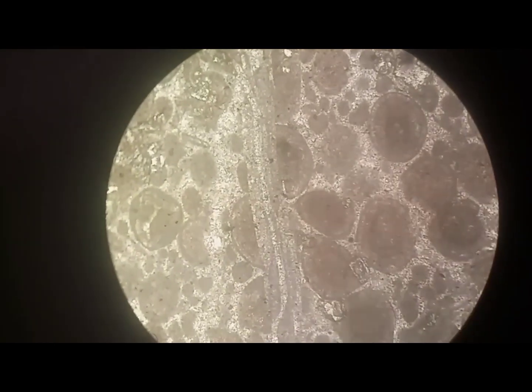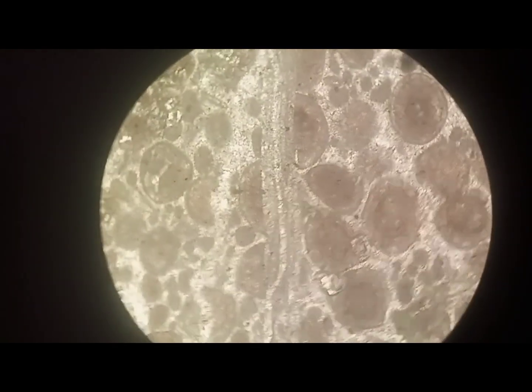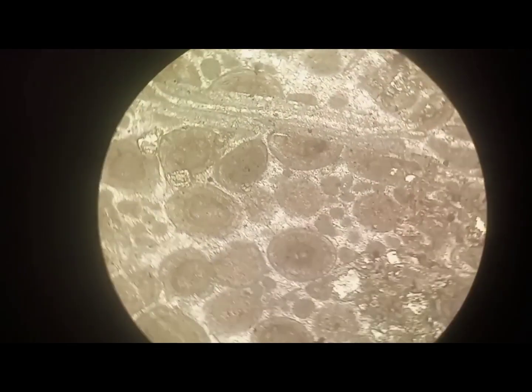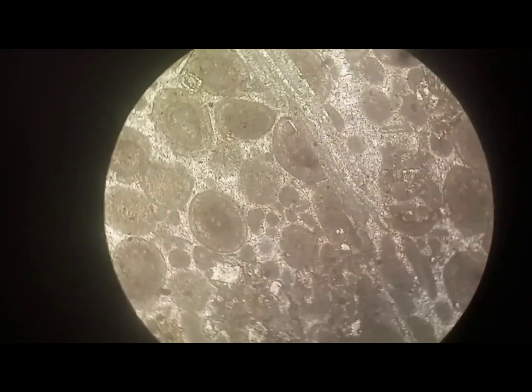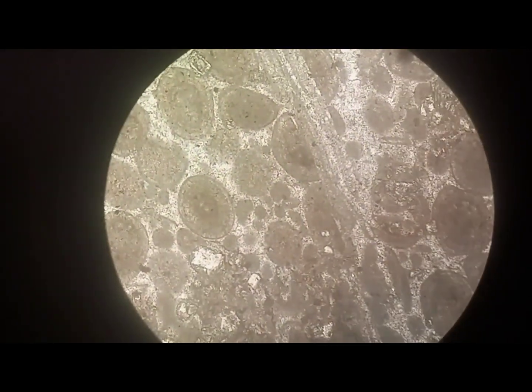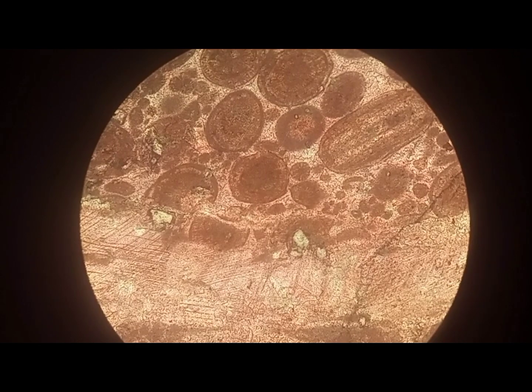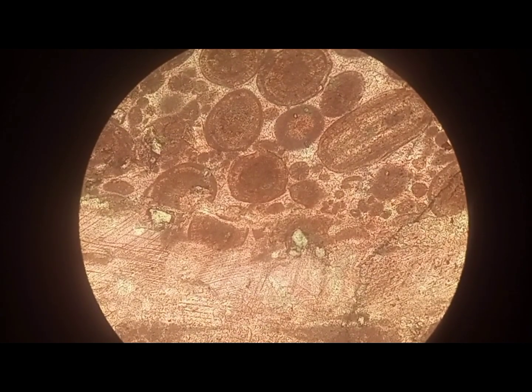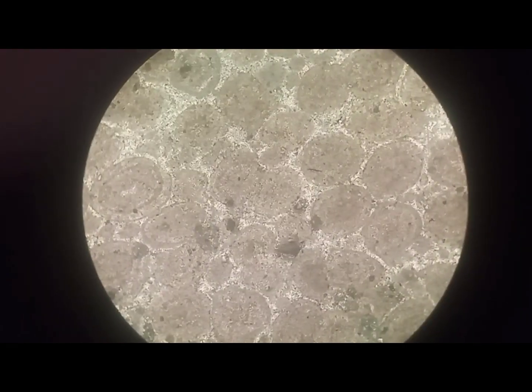In Pakistan, Ooids are found in the Jurassic Age in the Samanasuk Formation in the Northwest Himalayas. Ooids form and accumulate in waters of beaches, tidal bars, and saline environments.